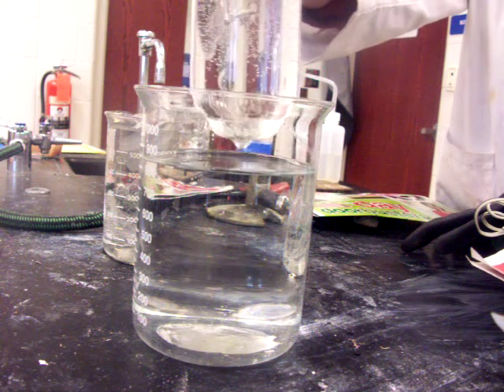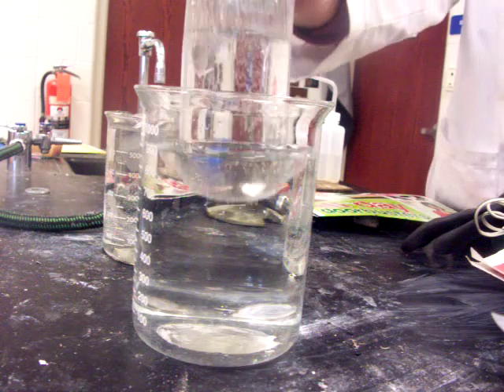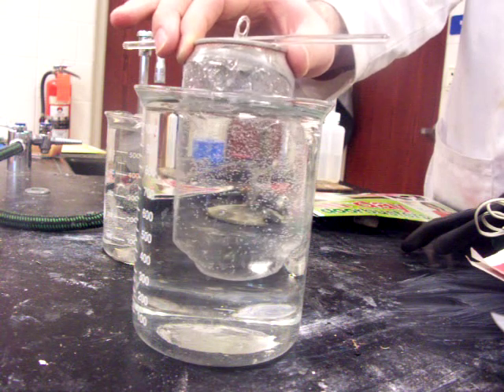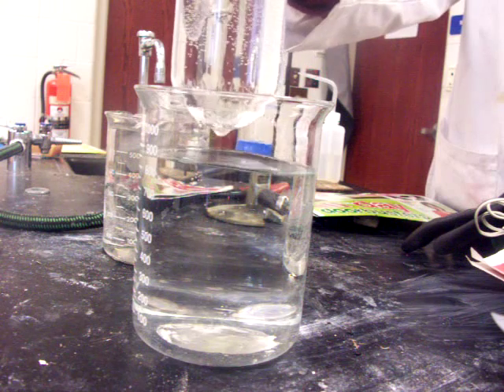By the way, I have rinsed them out and replaced the hydrochloric acid with water now. Notice when it goes down here, if it wasn't for the bubbles, you really wouldn't be able to see the can. But I've replaced the hydrochloric acid now, so this is water in here.